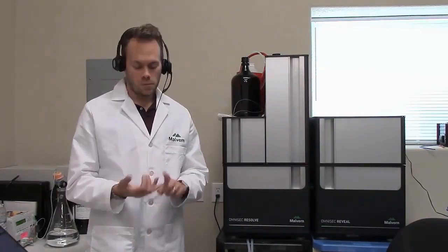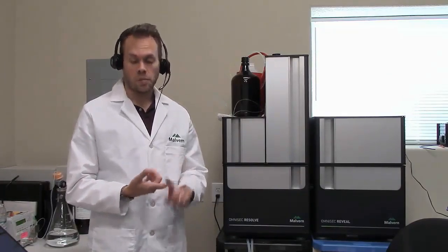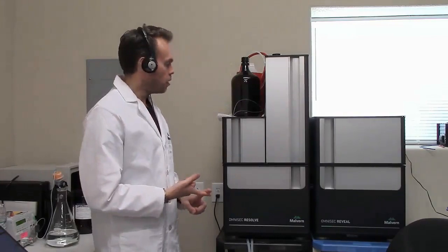We washed out all the salt, and then we flushed through new fresh water and then THF at a low enough flow rate so that the viscometer didn't go off scale. If the viscometer did go off scale, we purged DP immediately and slowed the flow rate even further. And doing that, I've been able to go from salty PBS buffer to THF in about 2 to 2.5 hours. It was about an hour to switch between each mobile phase.